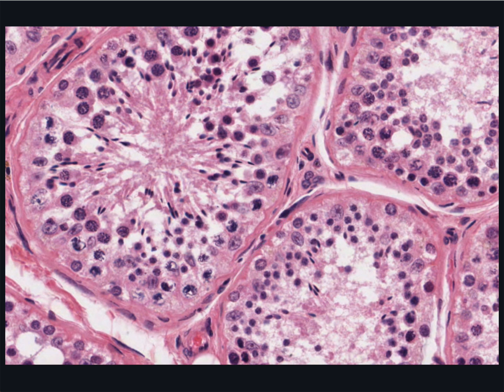The primary spermatocytes are easy to recognise because of their large size, or more accurately, the large size of their nuclei. It's difficult to discern their cytoplasm, which blends in with that of the surrounding Sertoli cells. You can actually see individual chromosomes as they condense in their nuclei. Look here and here.